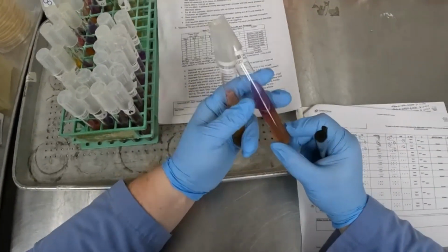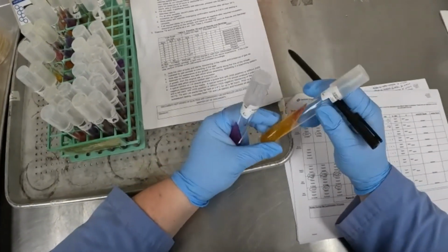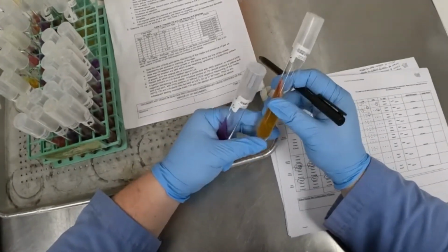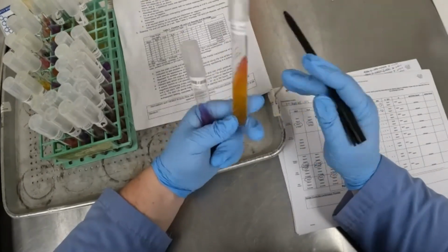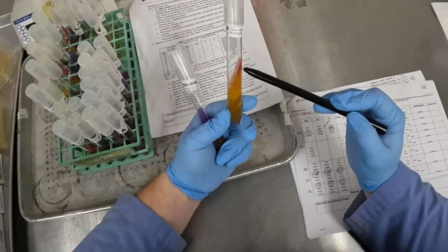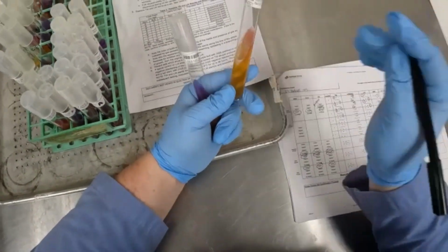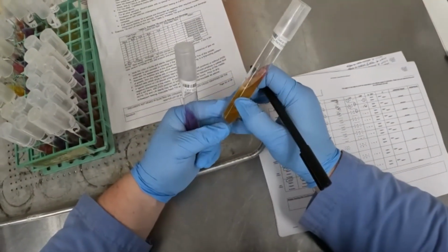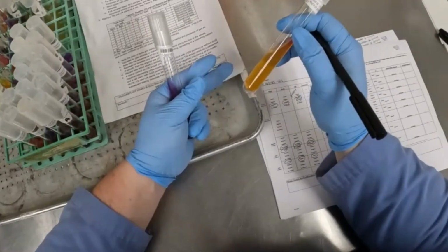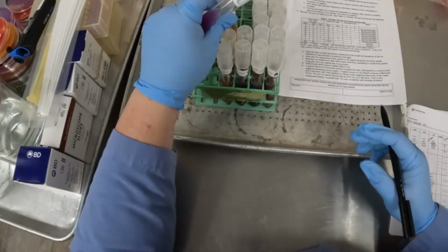For isolate C, we do have a little bit of a red here on the slant. This is pretty atypical. Salmonella usually does not produce this much gas. You can see where the gas has cut through the agar and split it. So we would still record this as R over Y, or red over yellow. Our H2S production is negative, so that would be no for H2S. And gas would be a yes. I'm seeing a common theme here.